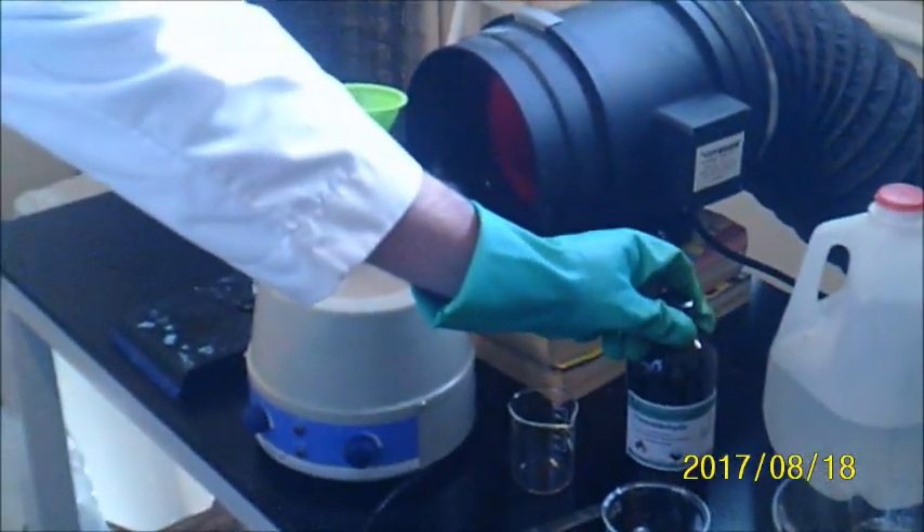Not pictured here, I added 2.5 grams of calcium hydroxide. Now we're ready to add our formaldehyde solution. I'm going to measure out 80 milliliters of formaldehyde. This is a 37.6% formaldehyde solution.